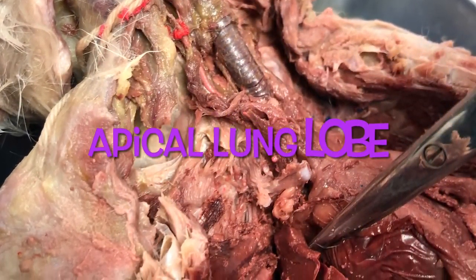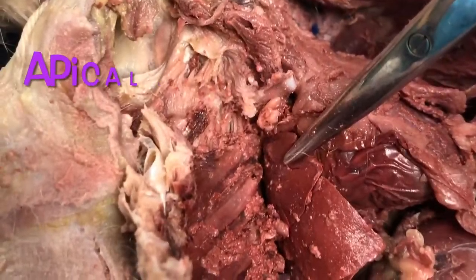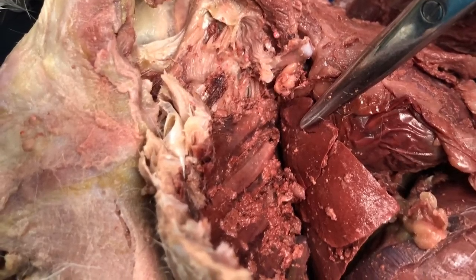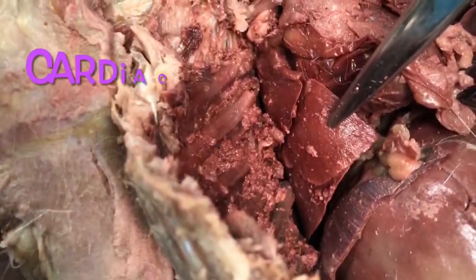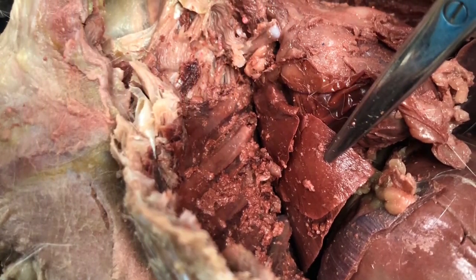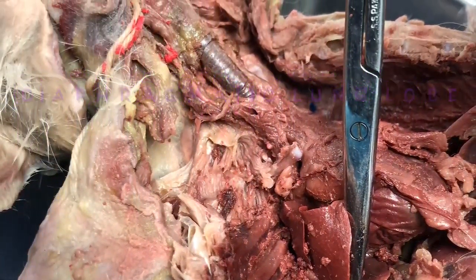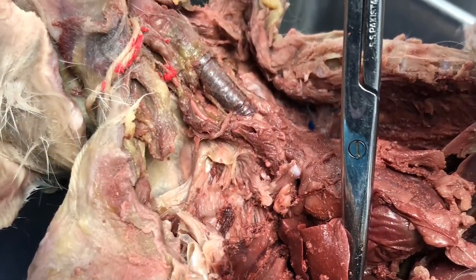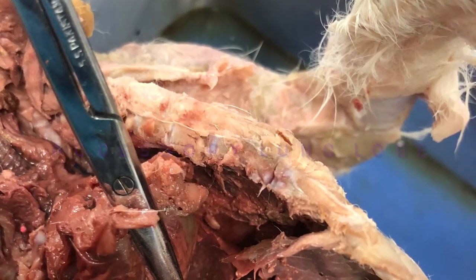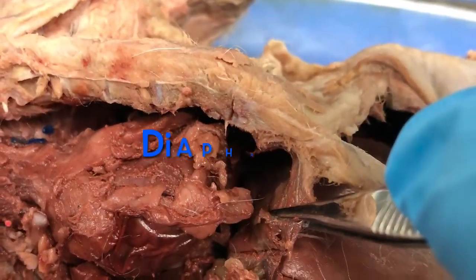The top lung lobe is the apical lung lobe. The cardiac lung lobe is the one in the middle, sitting right next to the heart. The diaphragmatic lung lobe is the third one down, sitting right on the diaphragm. And the accessory lung lobe also sits right on the diaphragm, tucked underneath.